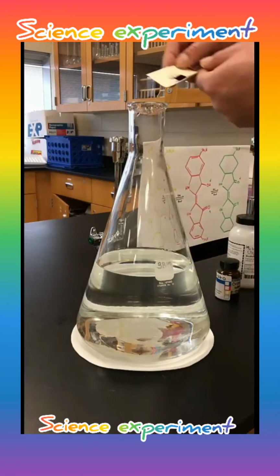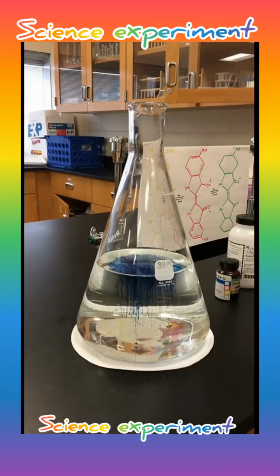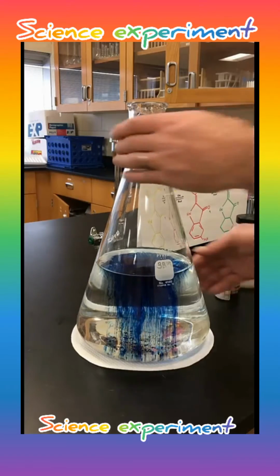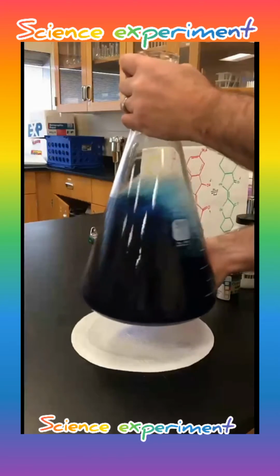Today we're going to show you the making of the chemical traffic light. Now for this reaction you really only need 4 ingredients: water and indigo carmine that I just added to the flask there. Indigo carmine is a blue food dye and it's also an acid-base indicator. We'll give that a little swirl to get it nice and mixed up.